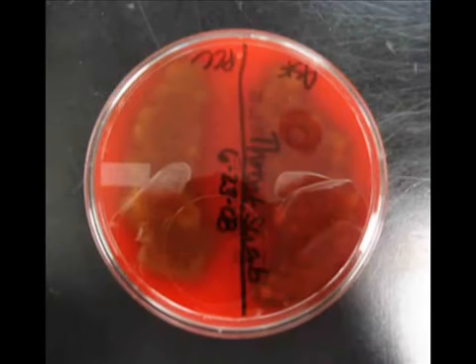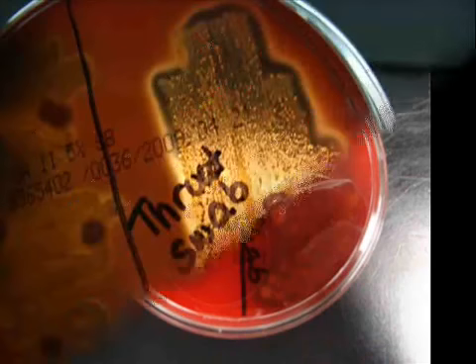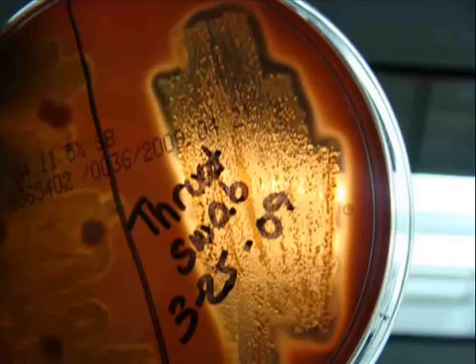So to review, gamma hemolysis, which is no color change in the medium when there is growth, and alpha hemolysis, which looks like bruising, both indicate the presence of normal flora. These are normal results. Beta hemolysis occurs when the bacteria growing on blood agar have completely broken down the red blood cells. This makes a clear or transparent area in the medium where the bacteria are growing.